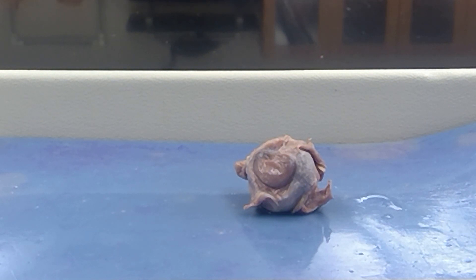Hello students. Now I'm going to go through the sheep eye dissection. I will do my best — I'm here alone doing this video, so I will try and keep everything in frame as best I can.